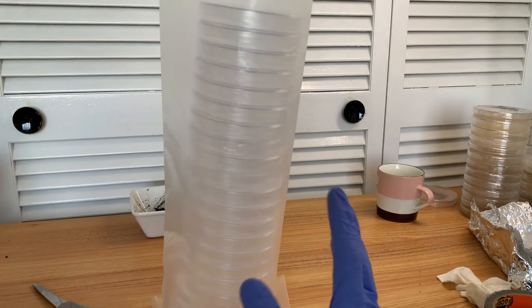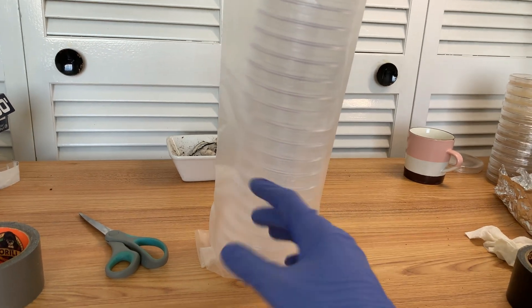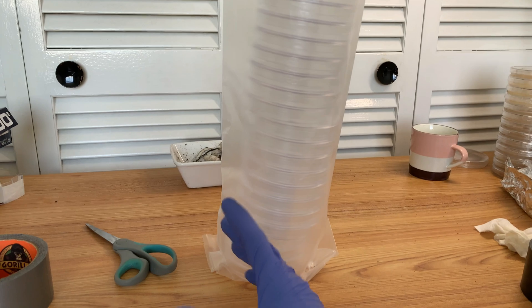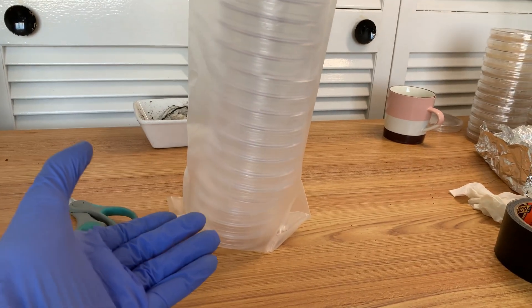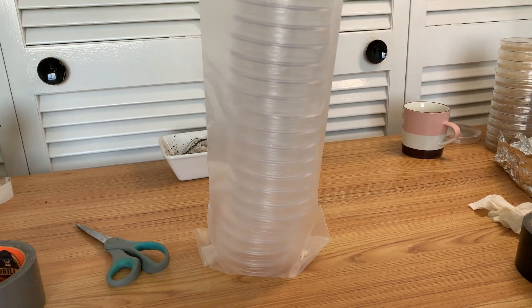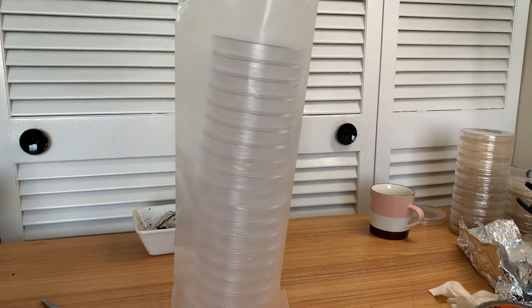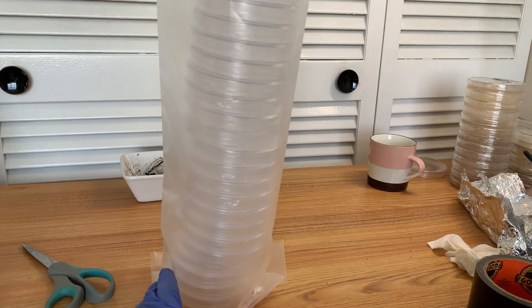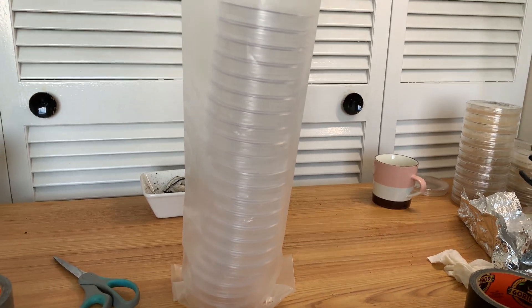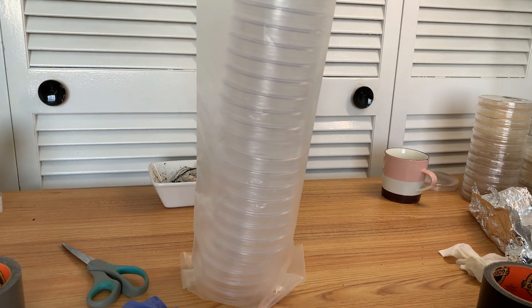Today we're talking about petri dishes. When you make your agar, sometimes you might pour a little bit too much and you might have a plate or two — or possibly more — leftover after your pour. A lot of people would just say that's a waste, it's finished. But over the last year I have been saving up for this experiment.